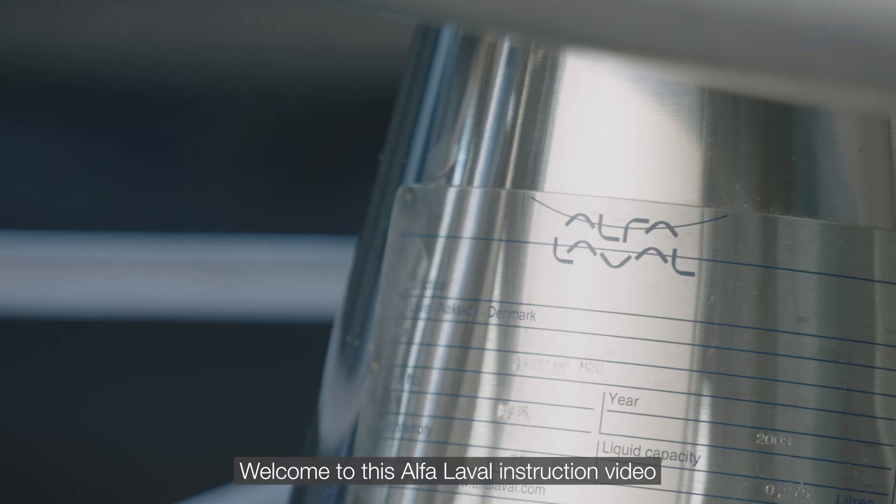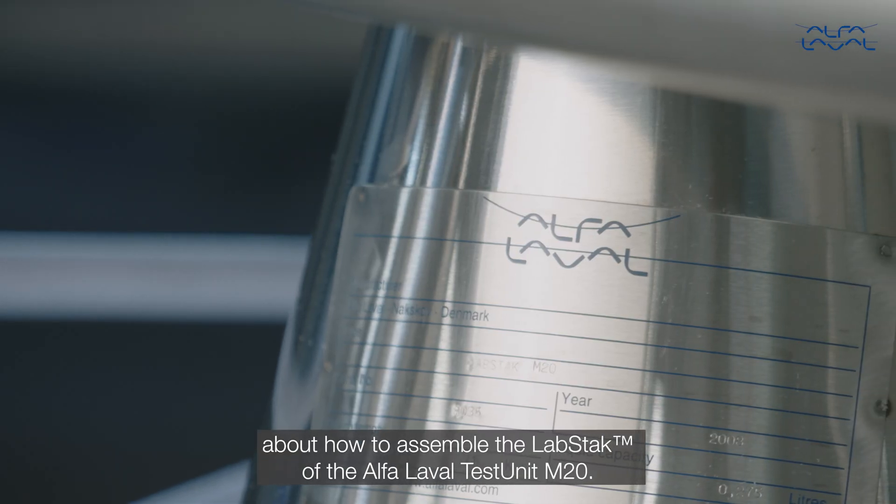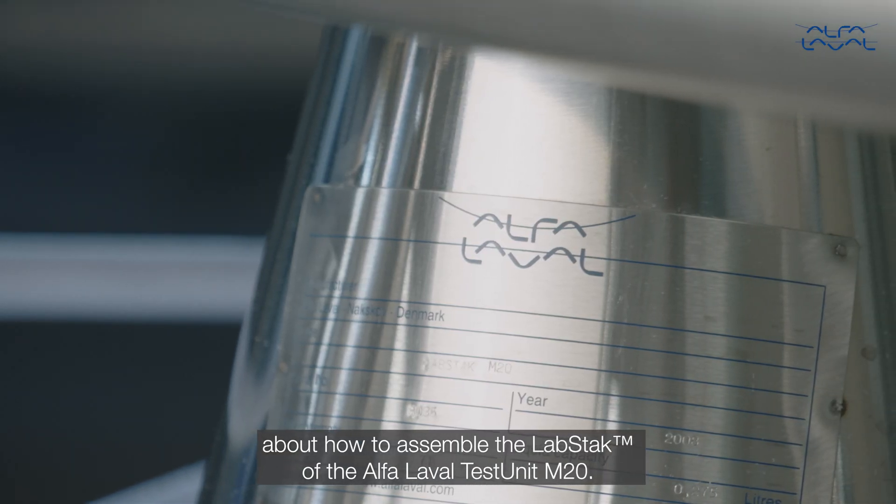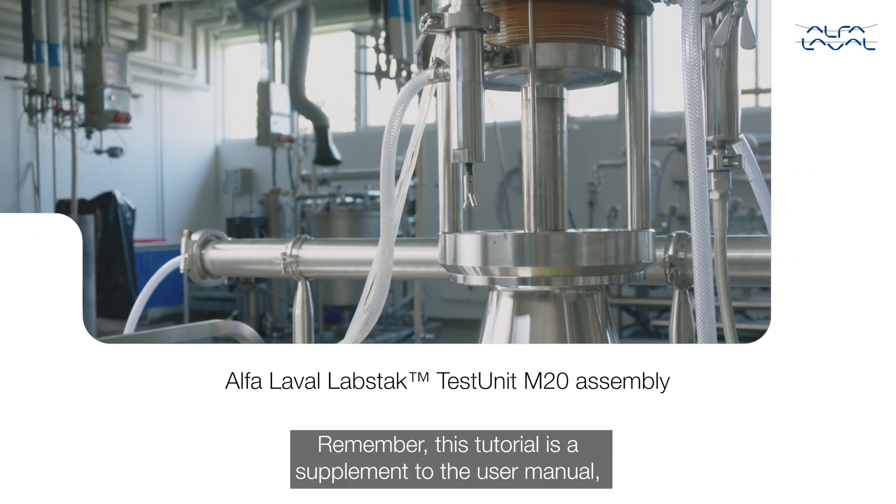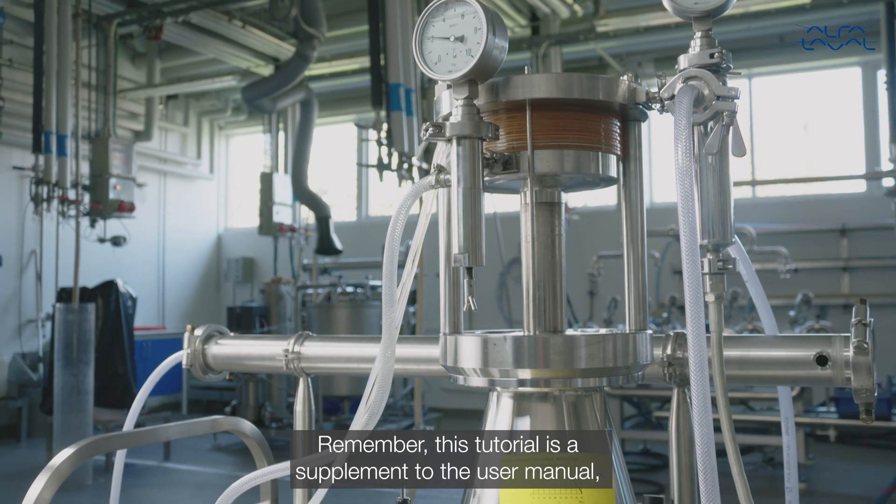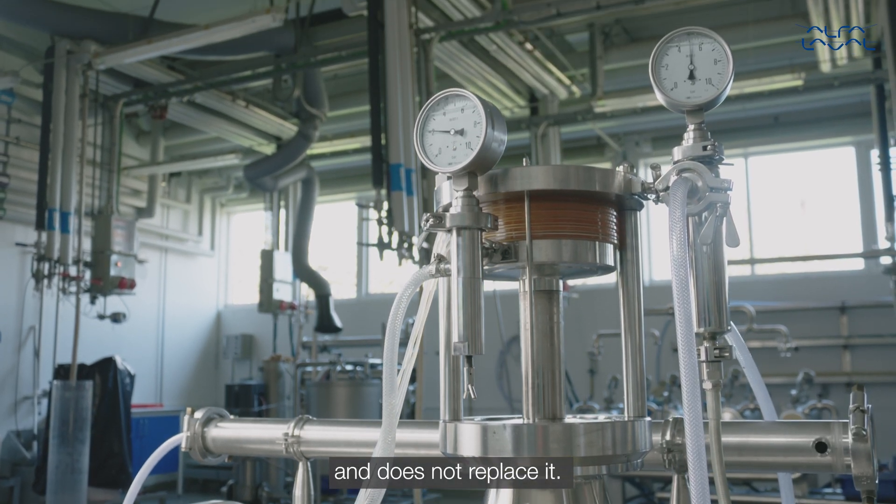Welcome to this Alfa Laval instruction video about how to assemble the lab stack of the Alfa Laval test unit M20. Remember, this tutorial is a supplement to the user manual and does not replace it.